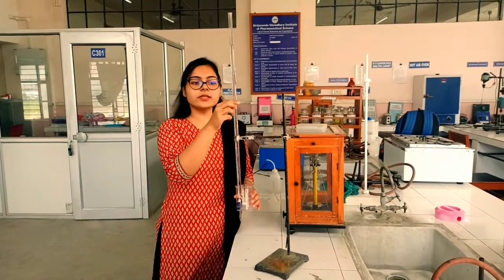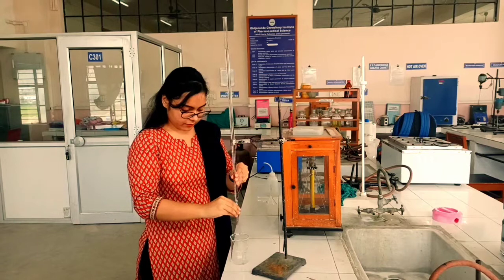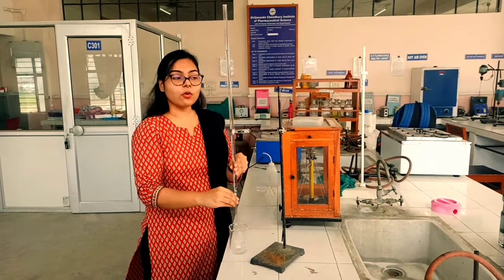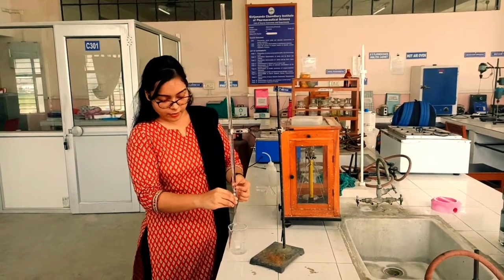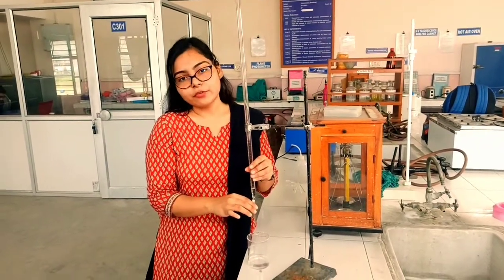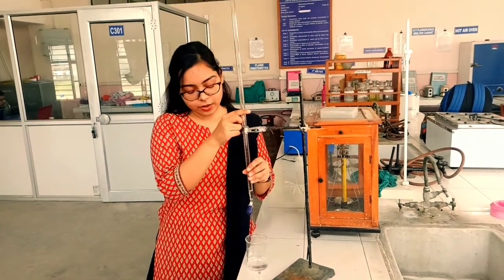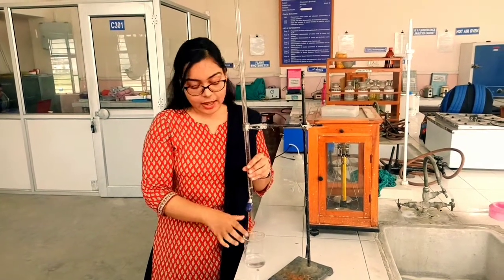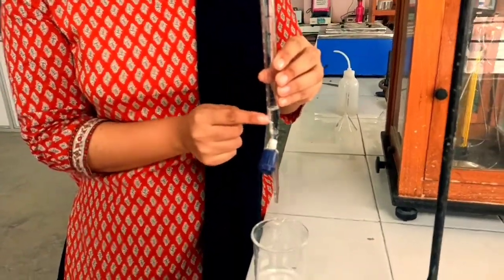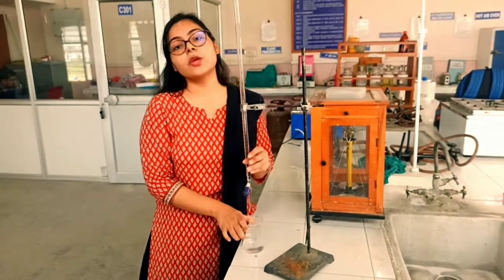We have to empty the contents of this burette into this beaker slowly. I will open the stopper and let the water flow into the beaker till the 50 ml mark. One thing you have to be very careful about while emptying the water into this beaker is that you must empty only till the 50 ml mark. You do not have to empty this part of the apparatus into the beaker, or else it can lead to a huge amount of error.